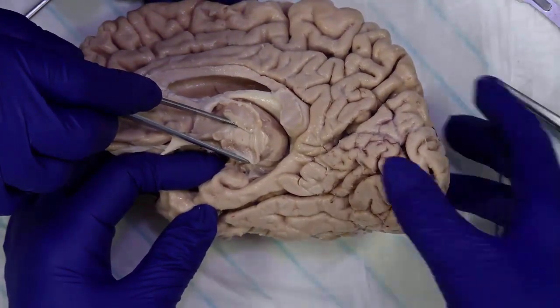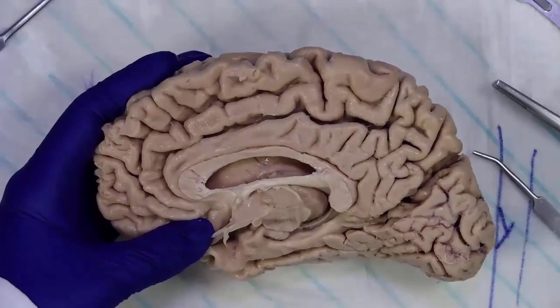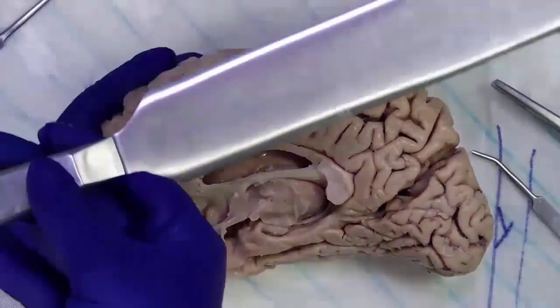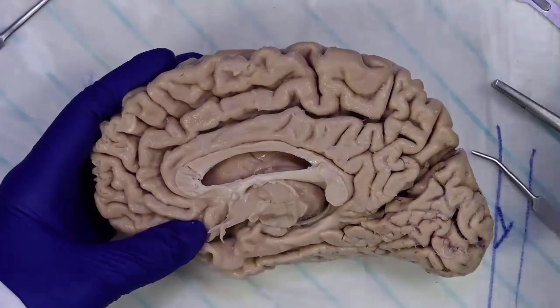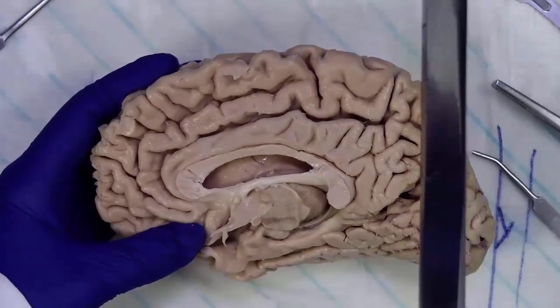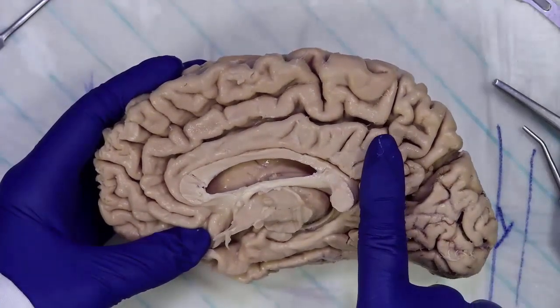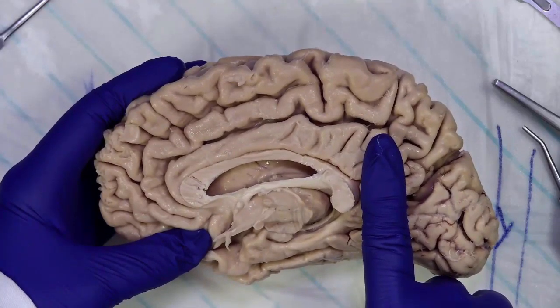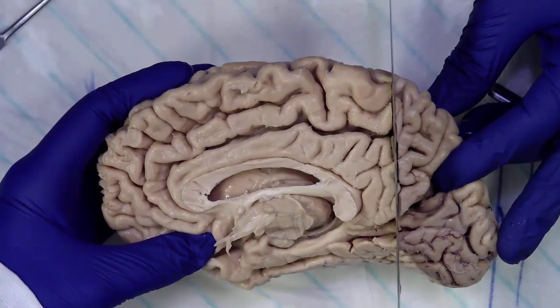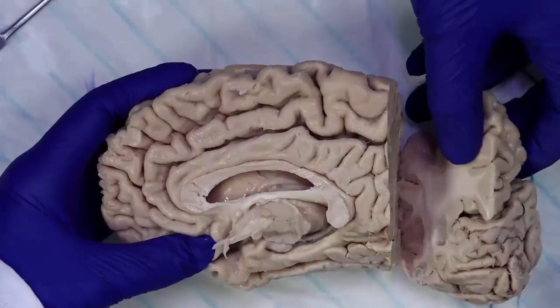One thing we can do is make an incision where the red line is in the picture in the PowerPoint. We use the blade — this special knife for cutting the brain, which we will provide. You have to be very careful because it's a little bit dangerous. Our reference is the splenium of the corpus callosum, and approximately one finger across through the occipital lobe, we make a perpendicular incision to cut and separate the occipital lobe, cutting cleanly through the occipital hemisphere.